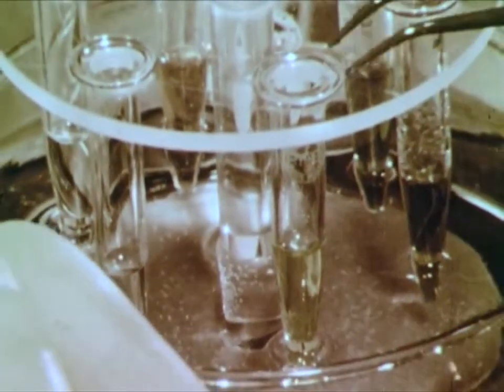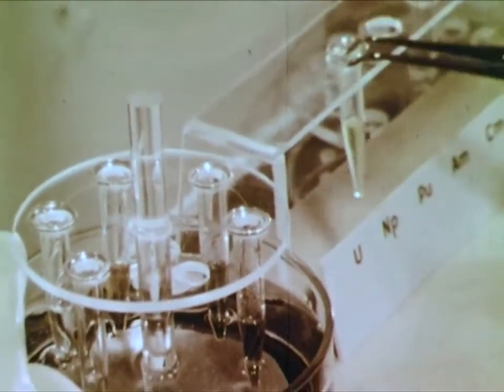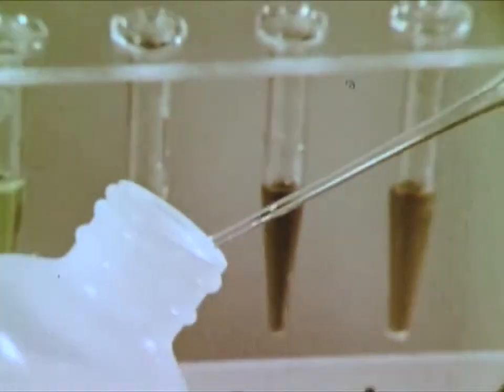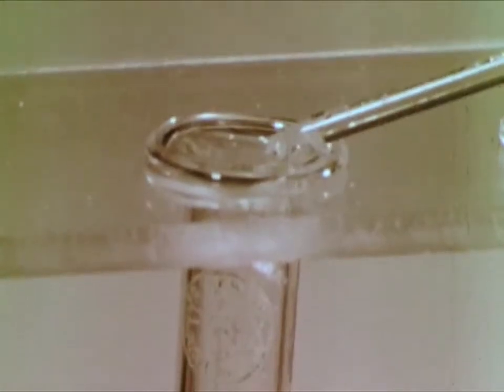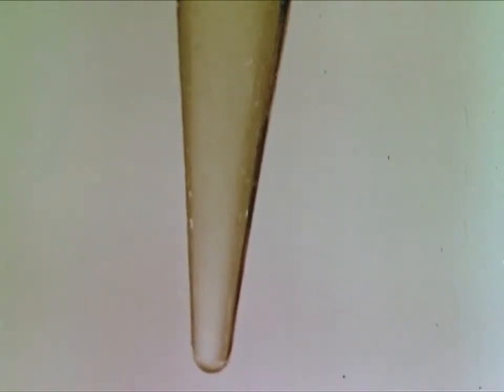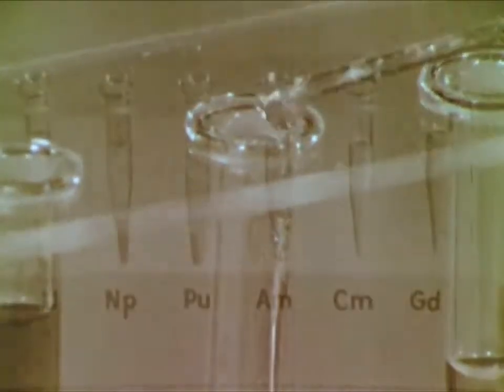Our first observation is that the solutions have changed color. This is an indication of a change in oxidation state. We'll test them to see if they are all in the same oxidation state. To make the test, we add a solution containing sodium acetate and sodium nitrate. A precipitate starts forming, which must settle before it is clearly visible. This precipitate is an indication that the uranium ions are in a plus-six oxidation state. Let's continue adding our acetate solution to neptunium, plutonium, americium, curium, and gadolinium.